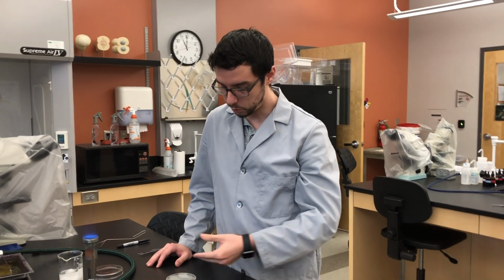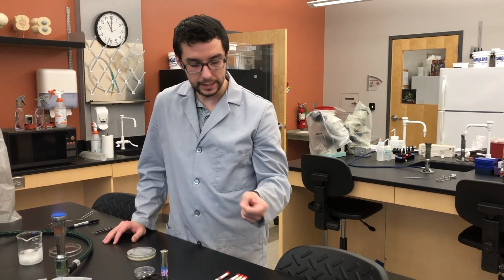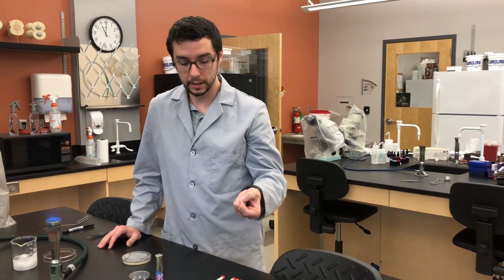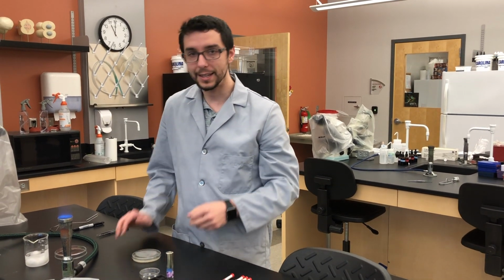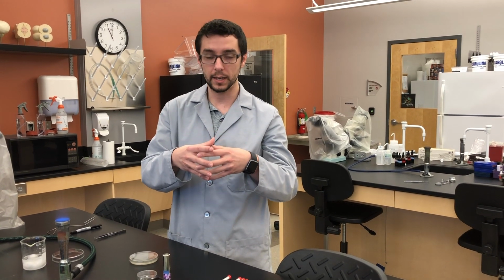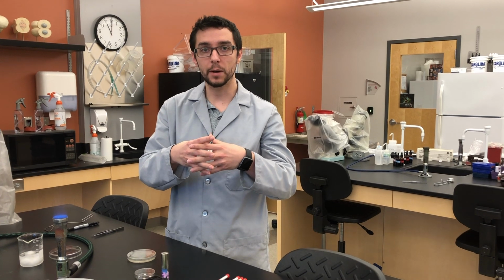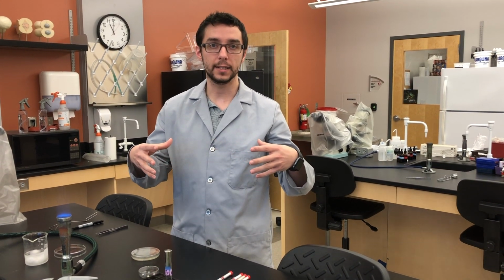I've already listed those off as we were labeling our plate. Each of these contain a disc. These little discs are soaked in antibiotic. That antibiotic disc is what we're going to be placing onto this plate, and over time, over the weekend, as your culture is growing, you're going to have that antibiotic slowly diffusing out away from that disc.